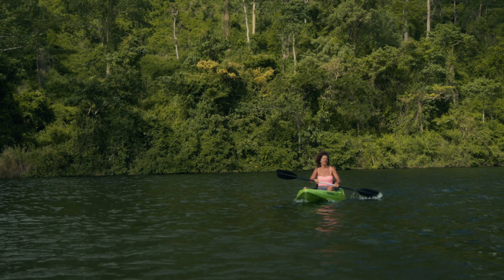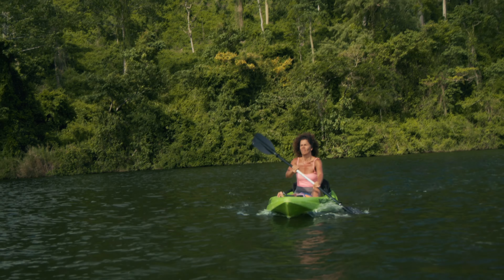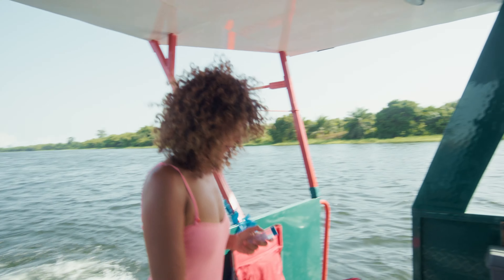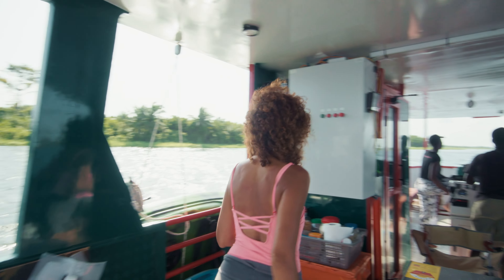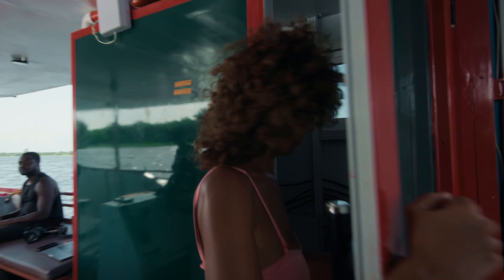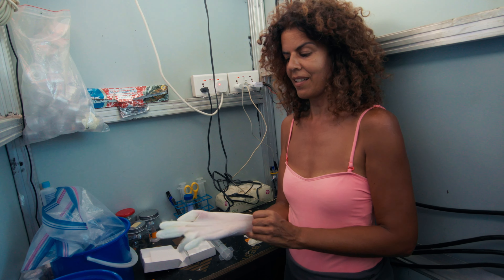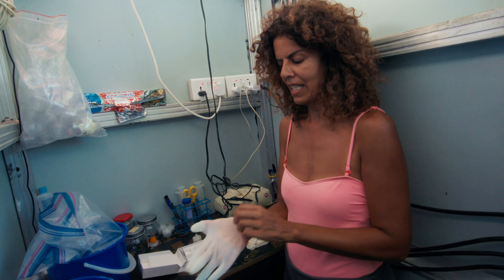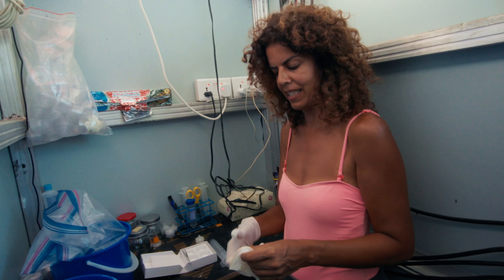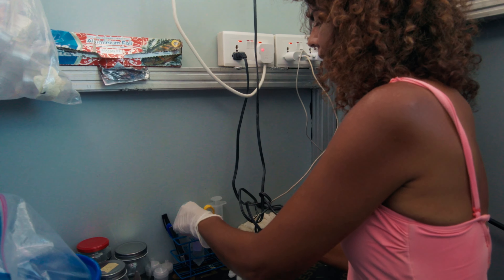These are four samples of the water we've collected at this sampling point, and for these samples we've collected the preliminary data — pH, temperature, turbidity, and salinity. These samples will be processed in the lab that we have on the boat. We'll be collecting microscopic images for each sample, and these images will then be checked by the lab in Accra so we can count the micro pollutants such as microplastics.